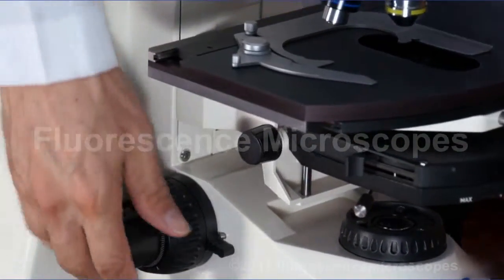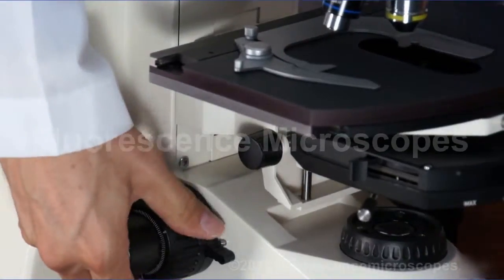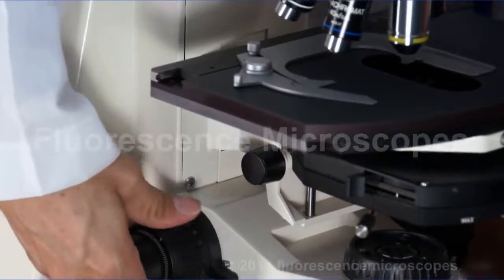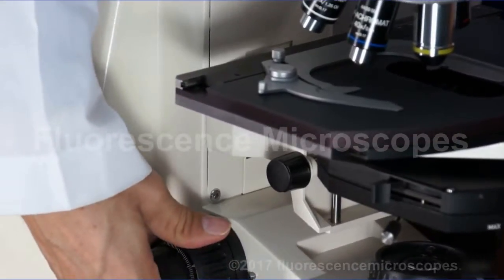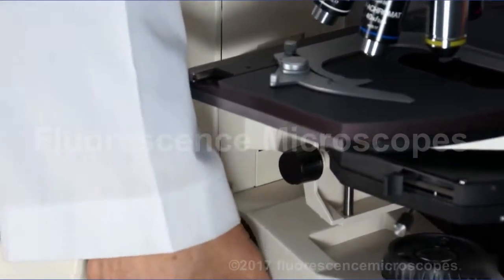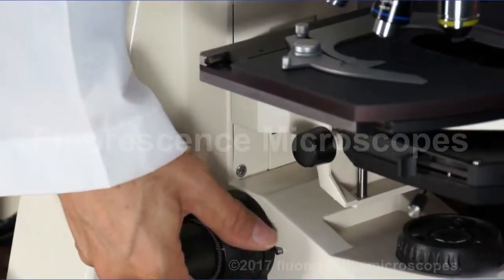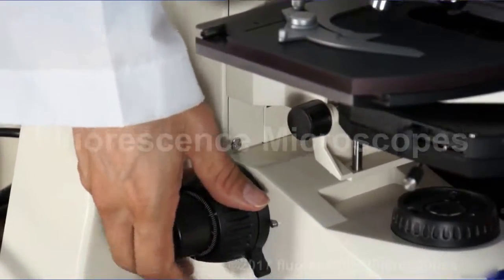The idea is you set this travel lockstop. You bring this all the way up. In the very maximum position you think you'd ever want to go, you're going to want to set it. And that way you don't break your slide.